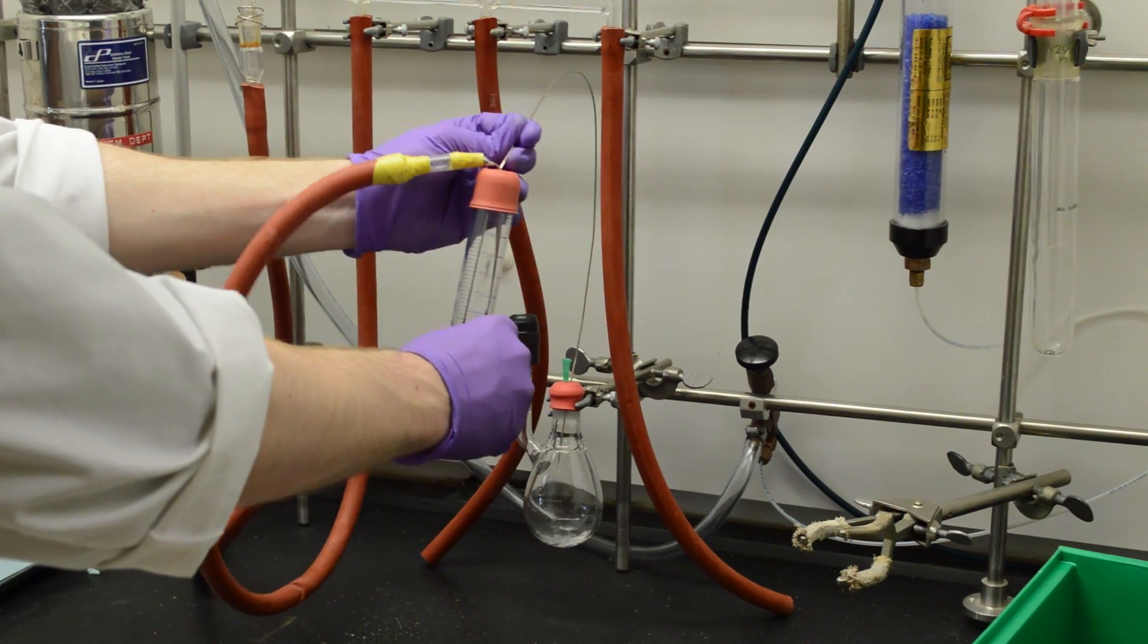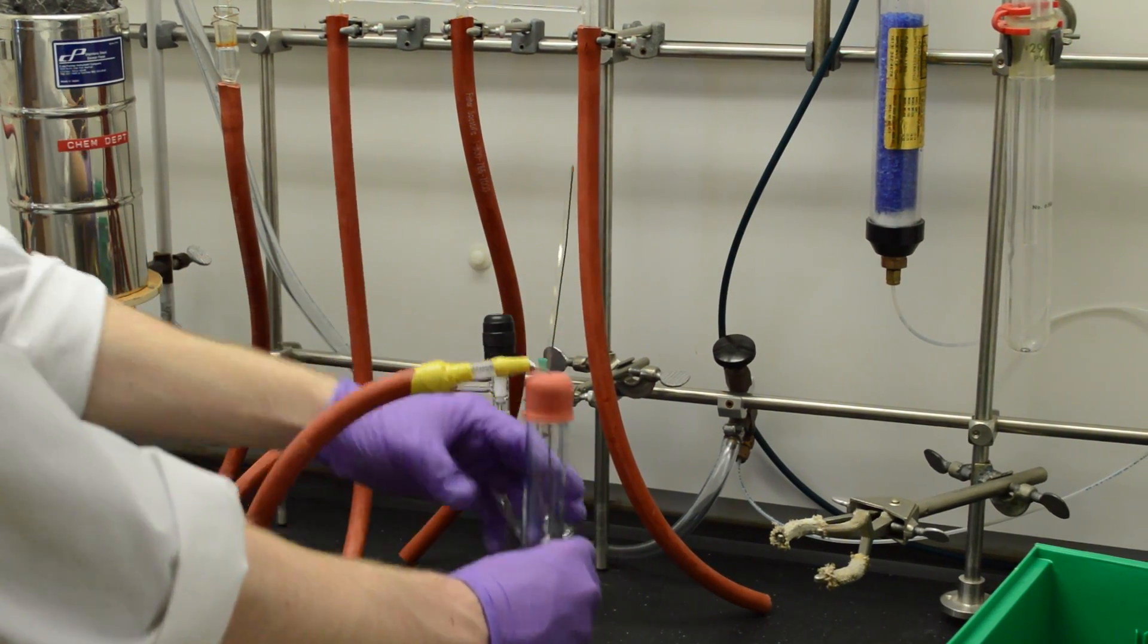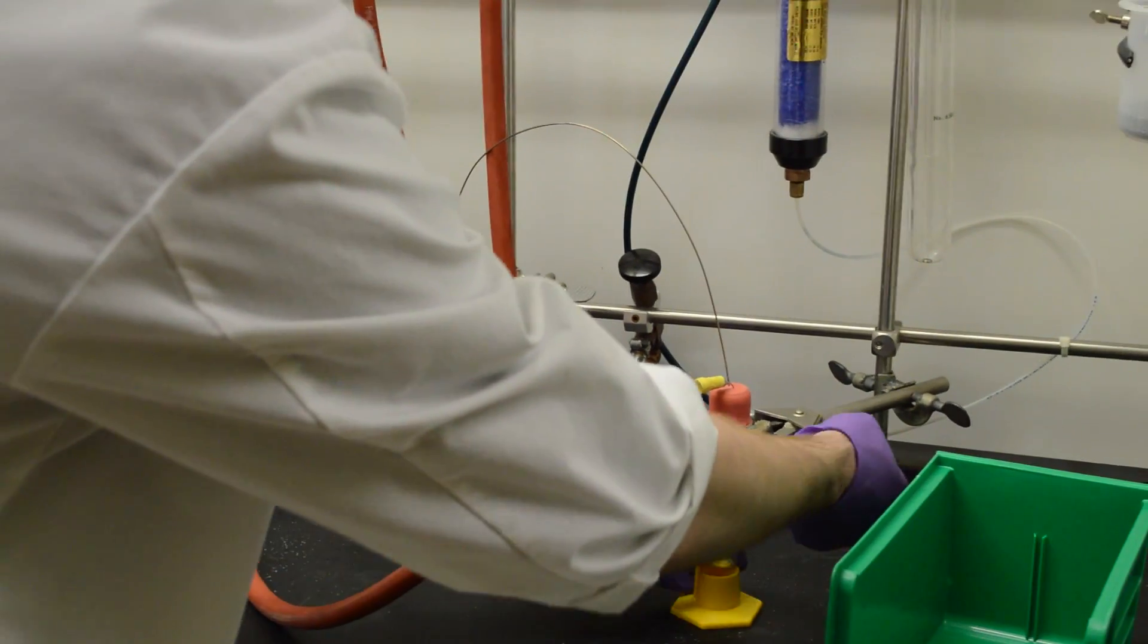Once you think you've got enough, you can just pull this end of the cannula back out of the solution, but leave it inside the graduated cylinder.